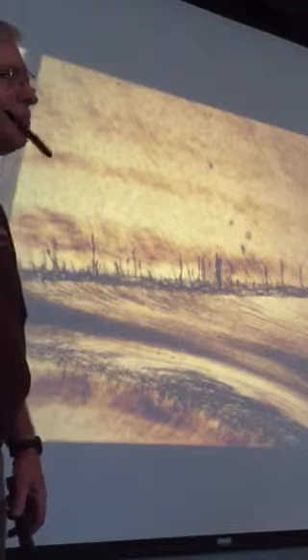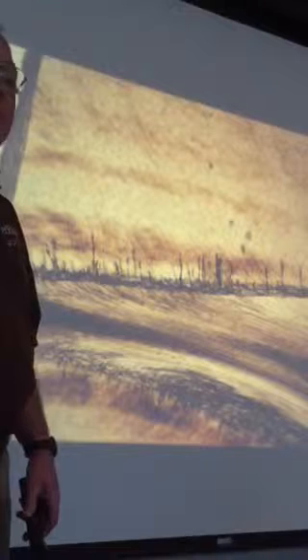And how about these right here? Enamel tufts, right? And how about these right here? Enamel spindles. In fact, some of those you can actually follow right down to the dentinal tubule, to the dead tract. So those are enamel spindles. How do those form? Yeah, an odontoblastic process pokes in between the ameloblasts, and it can't lay down any enamel protein there, so you get these gaps that show up black because they're filled with organic debris or perhaps some trapped air. So those are the enamel spindles.